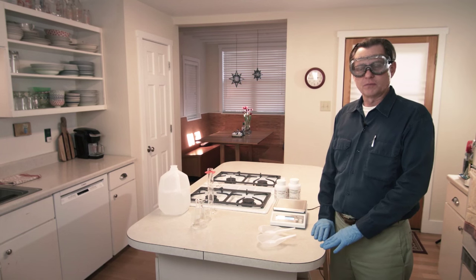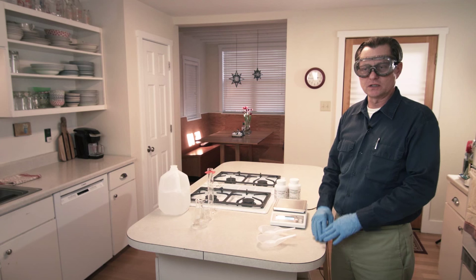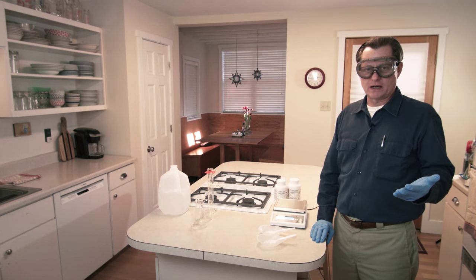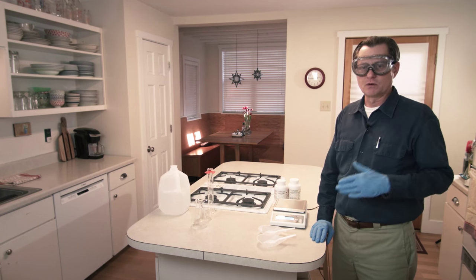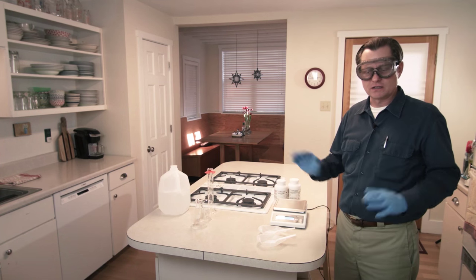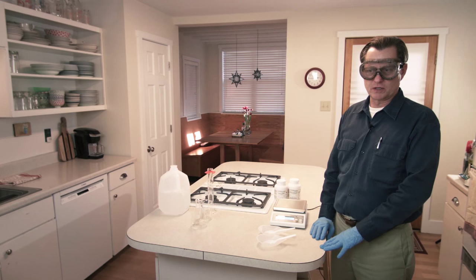This is one of the more complex sequences of experimental work that occur in the book, so this is one of those experiments where some people might not want to go to the trouble to set up and conduct it. We're preparing this video so that students can see the entire sequence in action, even if you can't do this experiment yourself.